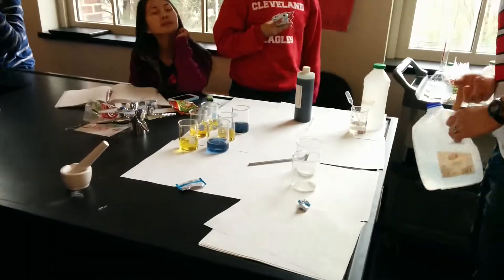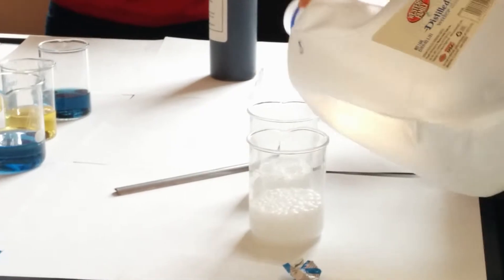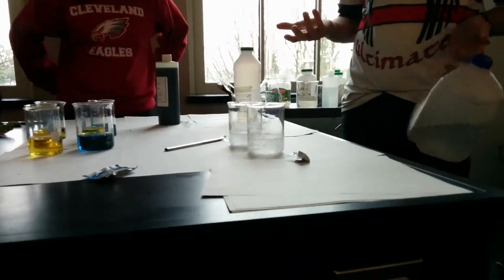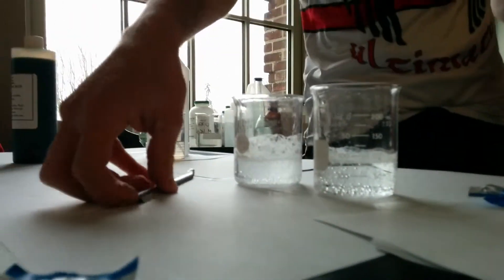So check this out — we're going to make two different solutions. Carbonates and bicarbonates always react with acid to produce CO2 and water. We know this from our previous demonstration. Is this really neutral distilled water? No, it turned pea yellow when we used the bromothymol indicator, right? So we know that this is slightly acidic, which is why it's already reactive. But you still have the compounds in here that can create a buffer.